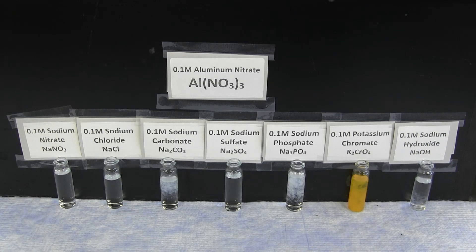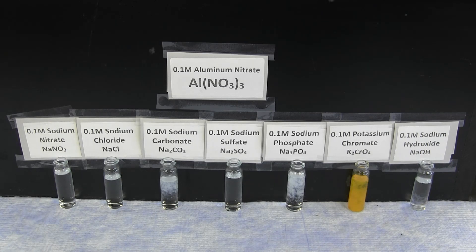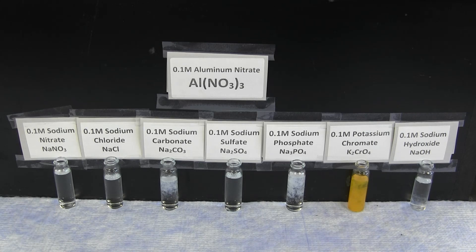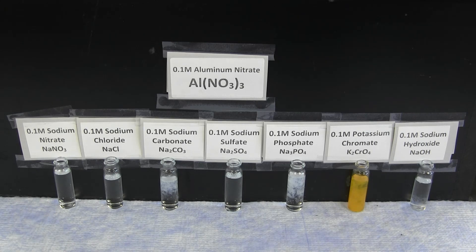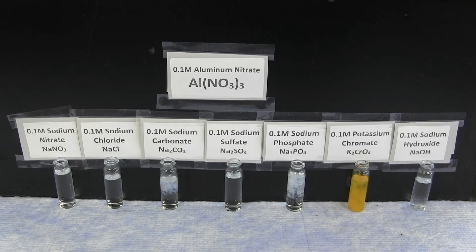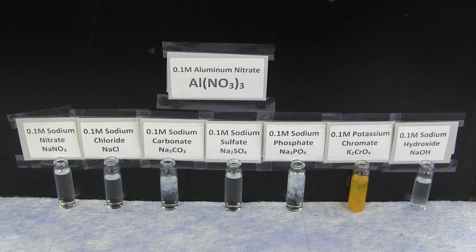There is no reaction with sodium nitrate, sodium chloride, or sodium sulfate.